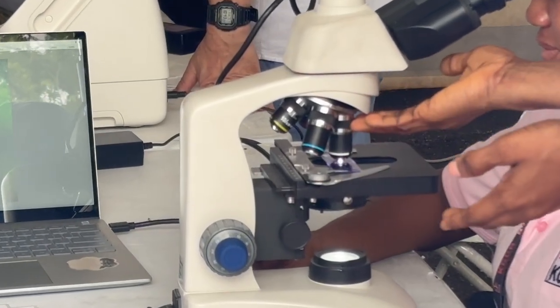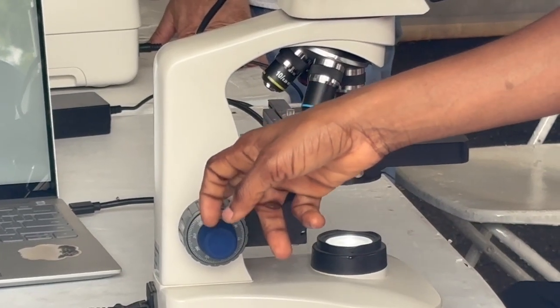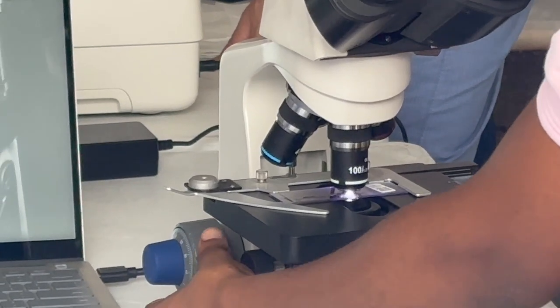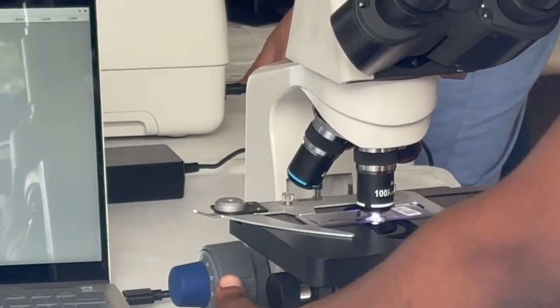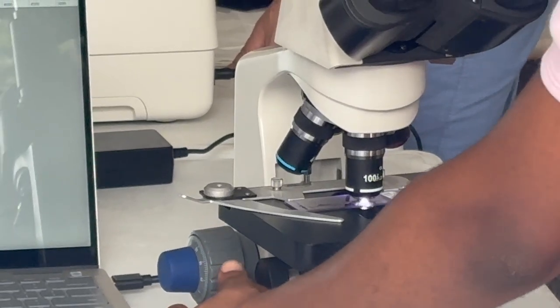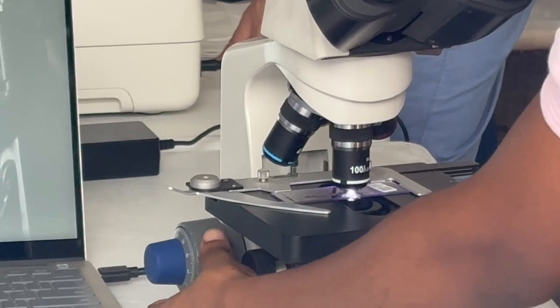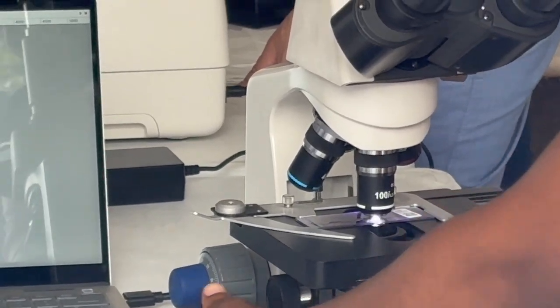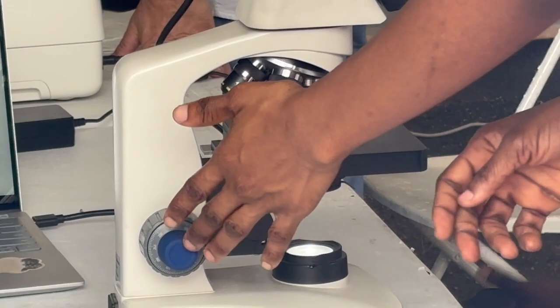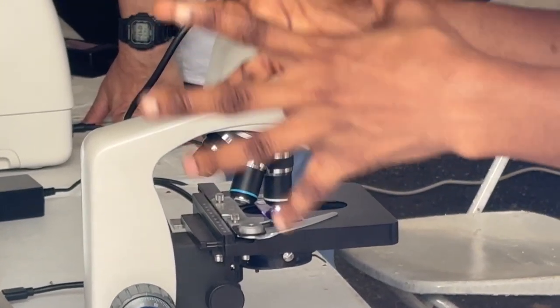And so now that you have the field of view centered and you are in a comfortable position, you can now start to use the coarse adjustment so that the stage will rise up a little bit towards the eyepieces. And you're going to do it until you see a bit of color, which is your organism or specimen coming into focus. But to really have the specimen be in focus, you need the fine adjustment. So you look for the fine focus knob in order to get it into perfect view for your particular eyes.